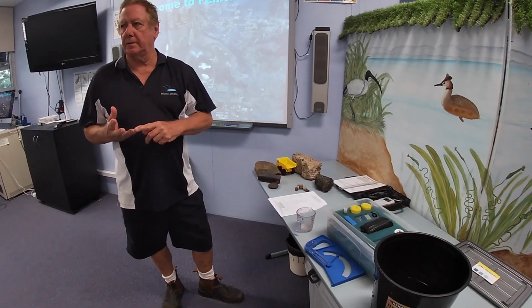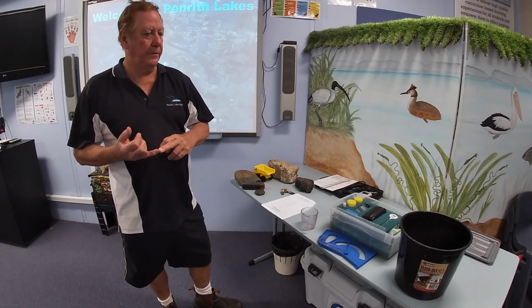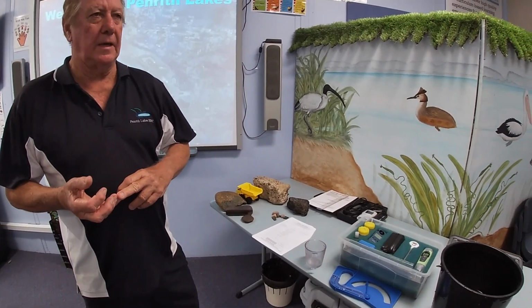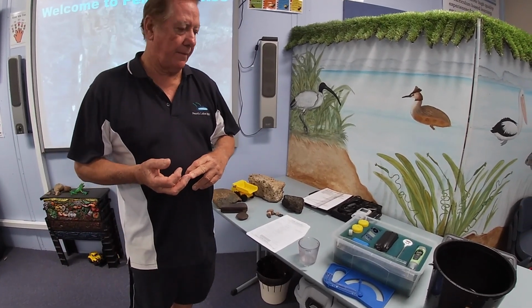Okay, now what you're going to do to assess today, there are three parts to the study or depth study. One part is to do with abiotic factors, and that's what I'm going to show you here. When we're out in the field, we've got to use our equipment to work out the abiotic measurements and then come up with some conclusions about that later on in the wrap-up.